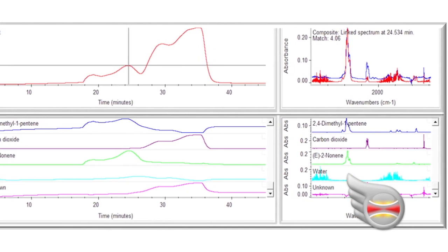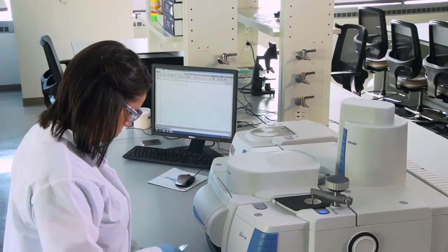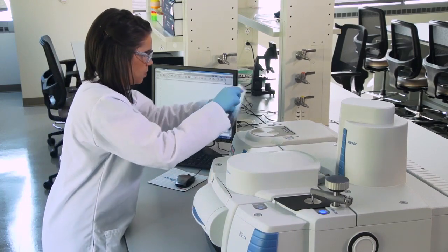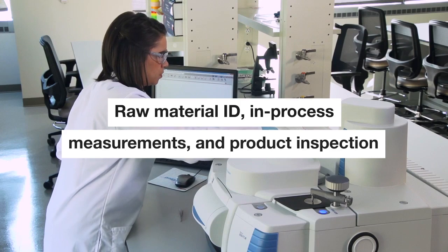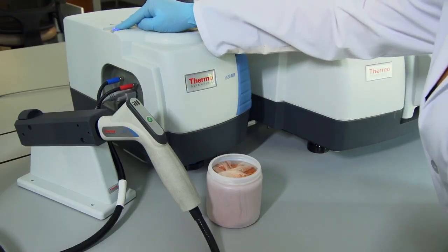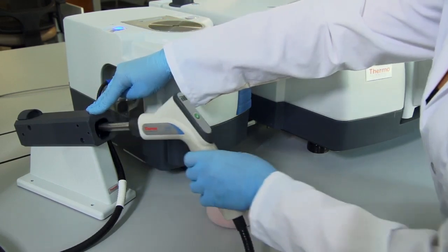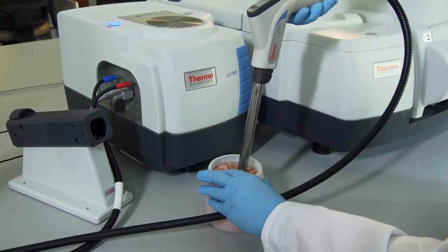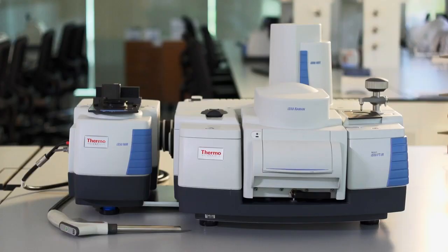Plus, it eliminates any subjectivity from the analysis. The IS-50 NIR module fully integrates with the instrument for raw material ID, in-process measurements, and product inspection. Featuring support for fiber optic sampling and an integrating sphere, the IS-50 NIR module also creates the ultimate QC method development workstation.